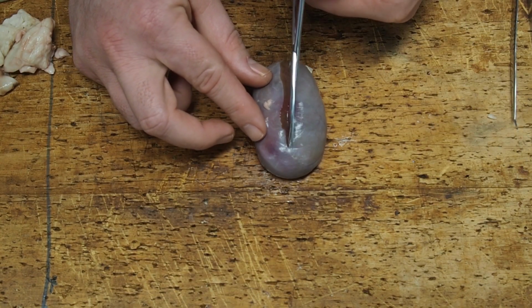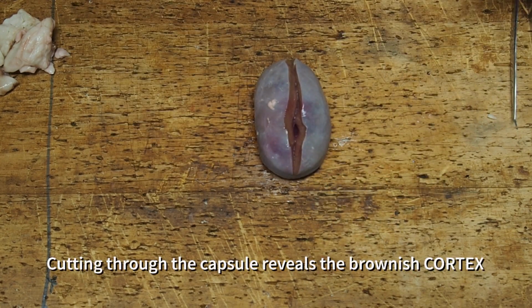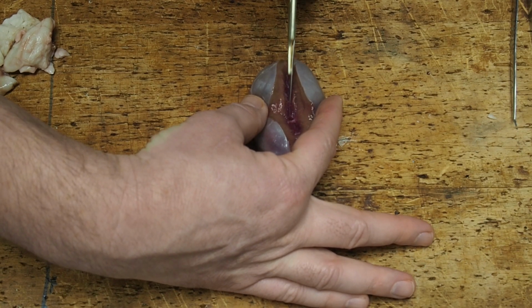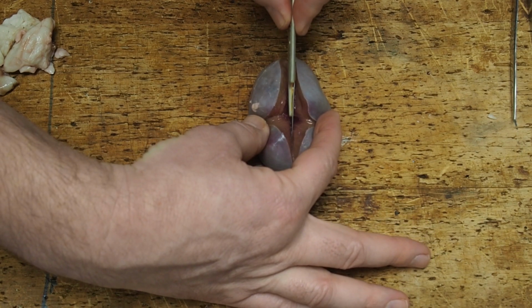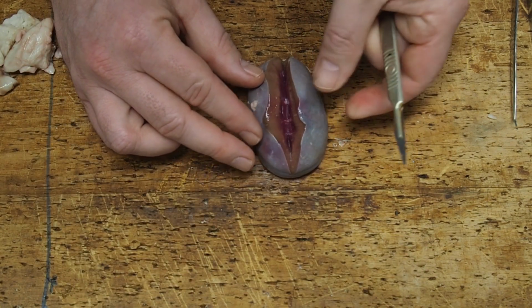So the first layer that we can see is a brownish colour, and this is a layer called the cortex, C-O-R-T-E-X. And as I go in a little bit deeper with a scalpel, you start to see a more pinky red layer appearing, which is the medulla.